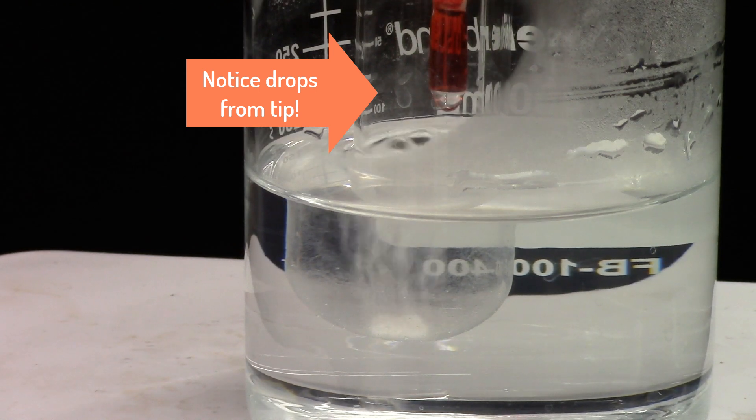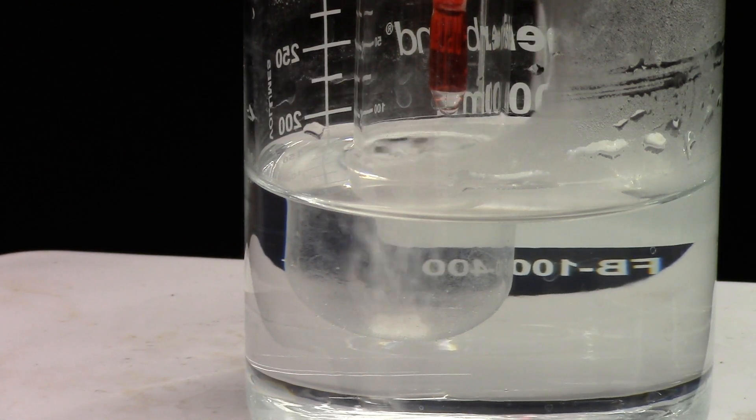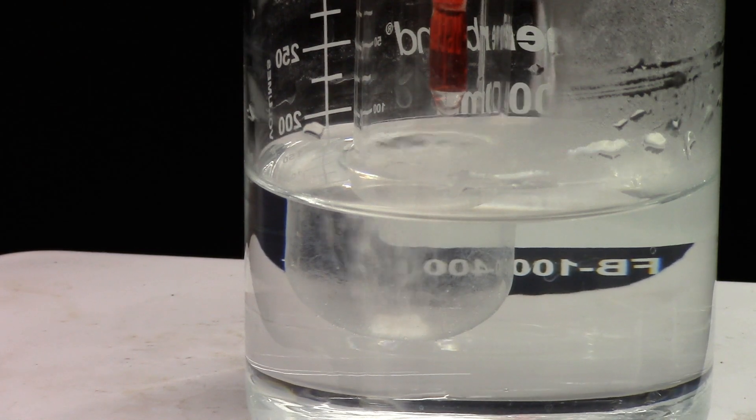We see a steady drip from the tip of the thermometer, and we are going to take a look at the temperature.